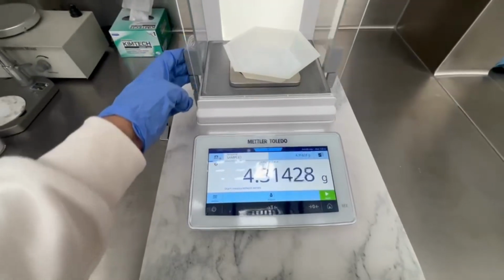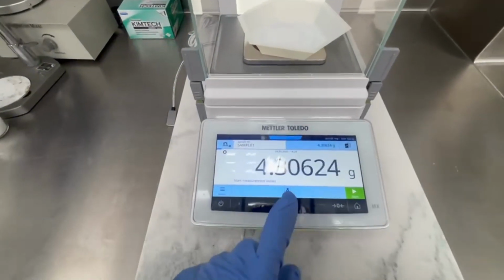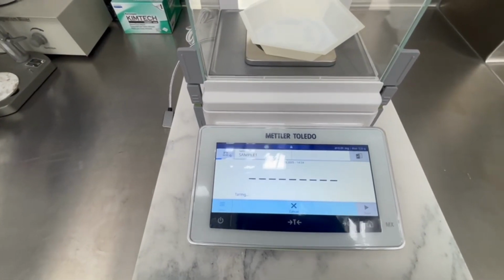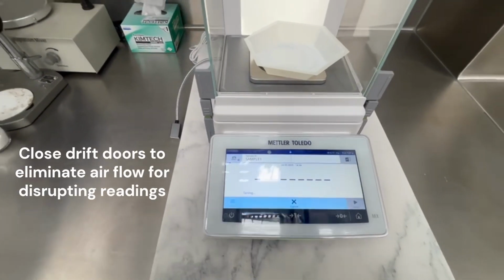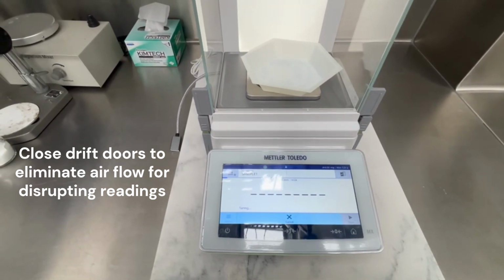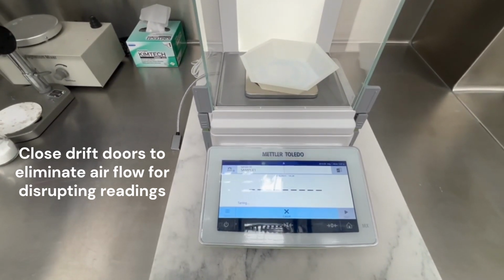For the analytical balance, turn on without the weighing vessel on the scale. Then follow the same calibration steps as the precision balance. Next, open the draft doors to insert the weighing vessel. Make sure to close the door when taring and weighing to minimize the noise and external factors that can influence the scale, especially for smaller samples.